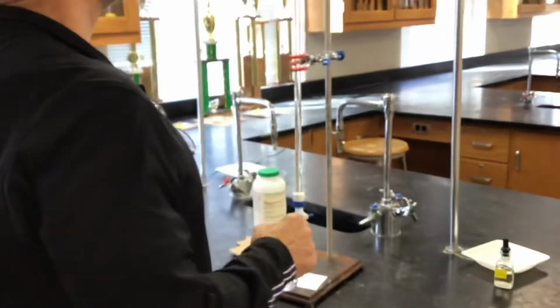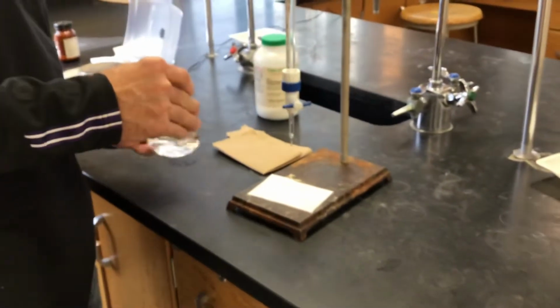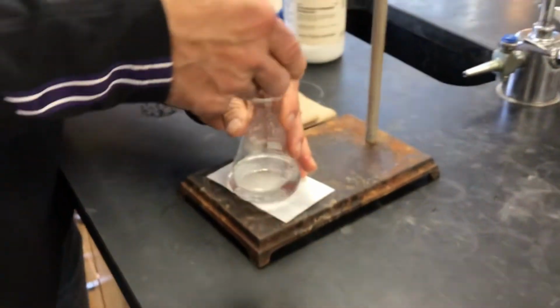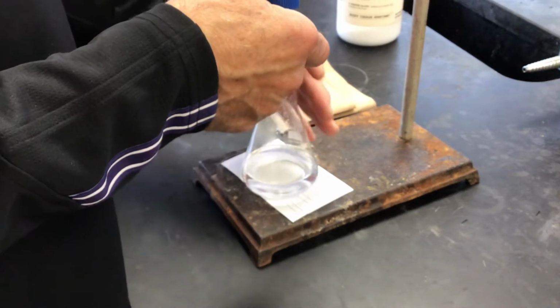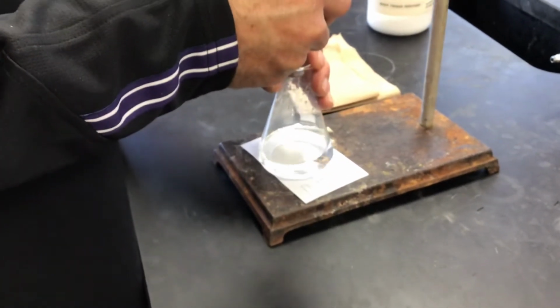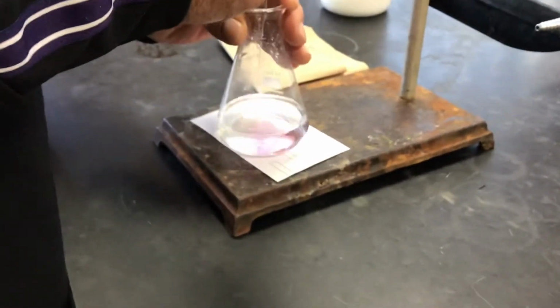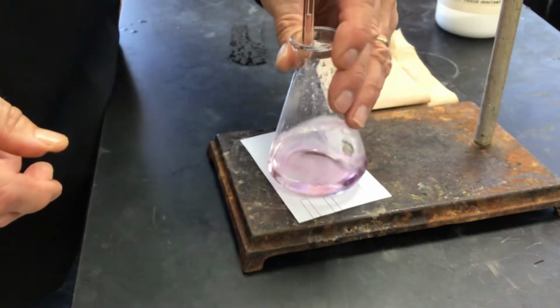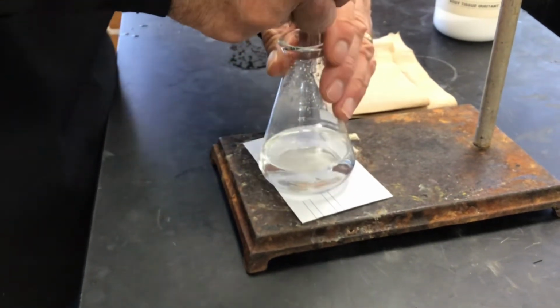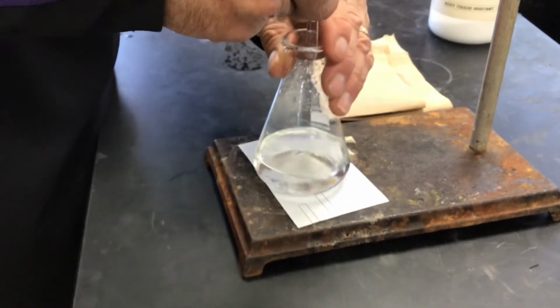All right, so that last time was just about 3.5, so here we go. Run it down. We hope this is our second and final trial. I'm going to run it quick down to 6. Now I'm going to try to go carefully. Oop, that wasn't careful.